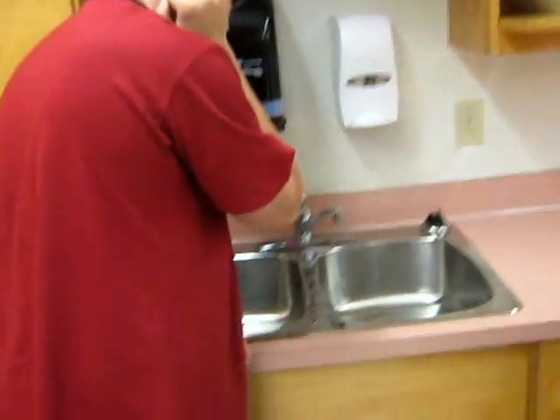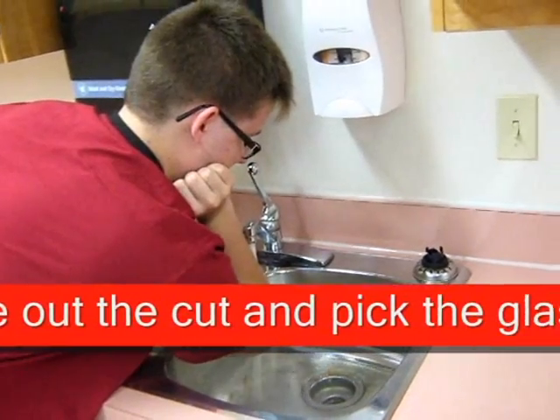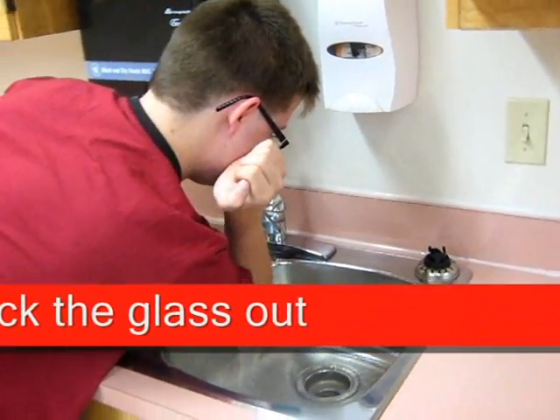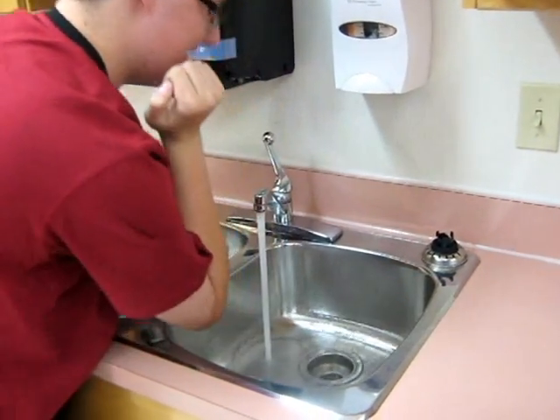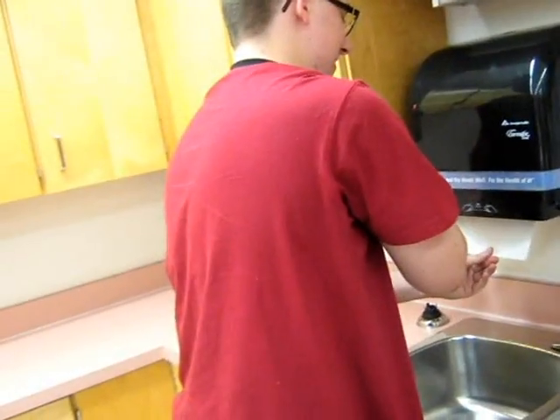Ow. What do I do? I rinse my cut, and then I slowly pull out the glass. Yay! So I gotta wrap it.